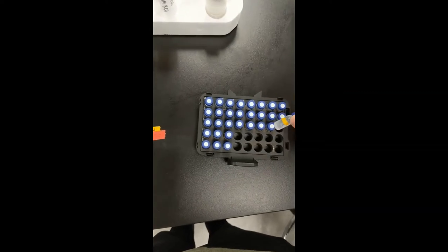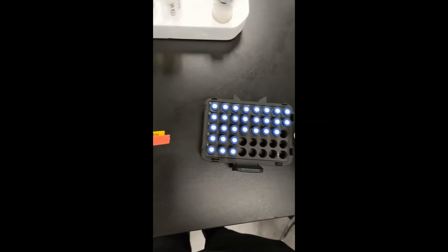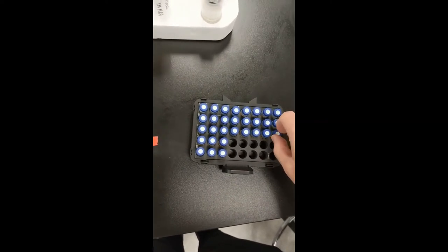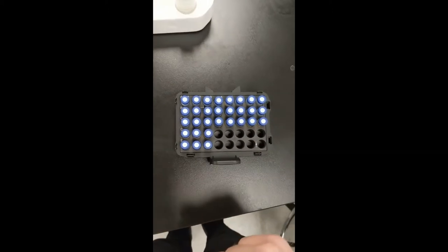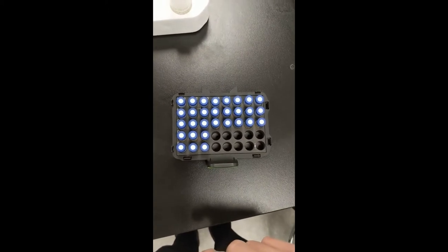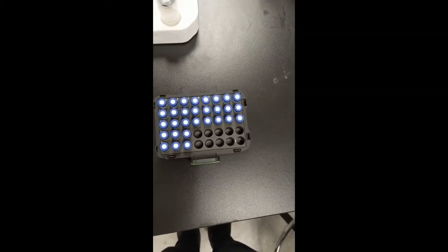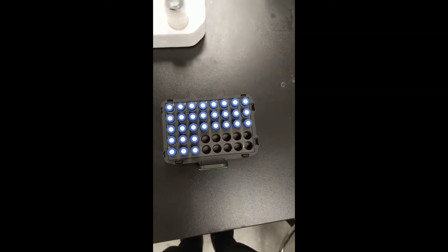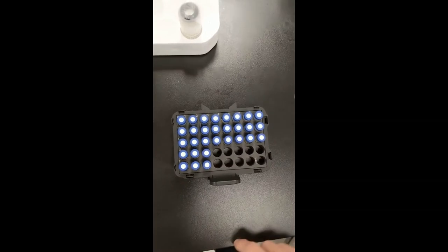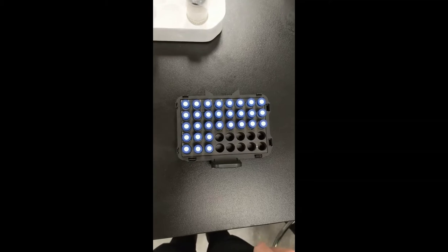It's important not to put tape on your samples. If you put tiny pieces of tape above the top it's fine, but tape around the body can make vials get stuck inside the tray and makes them harder to wash. So how do you remember where your samples are? Write it in your notebook — write down which sample is in which position. That's the easiest way.